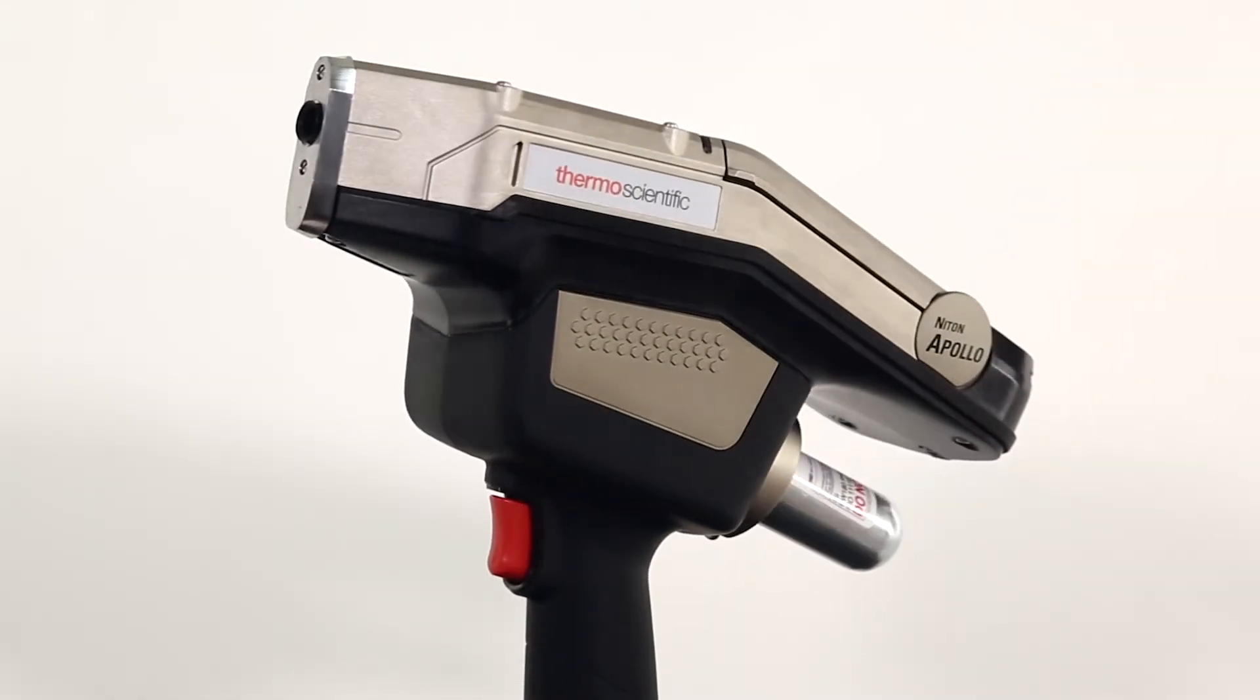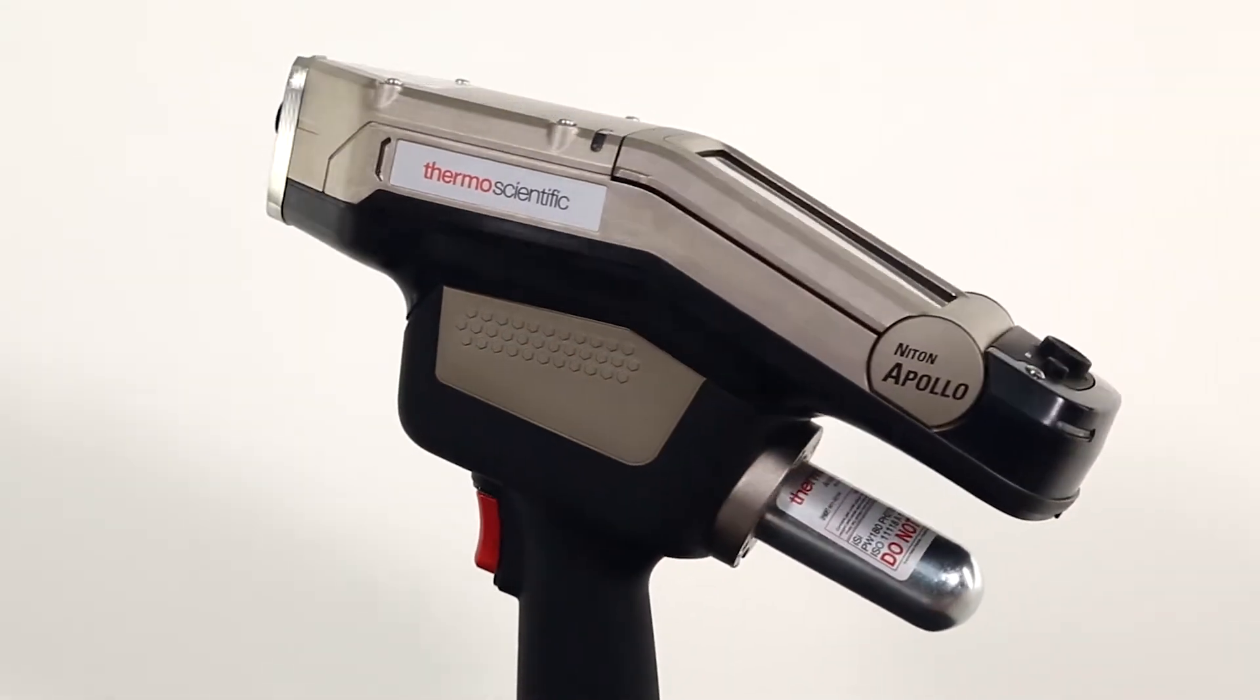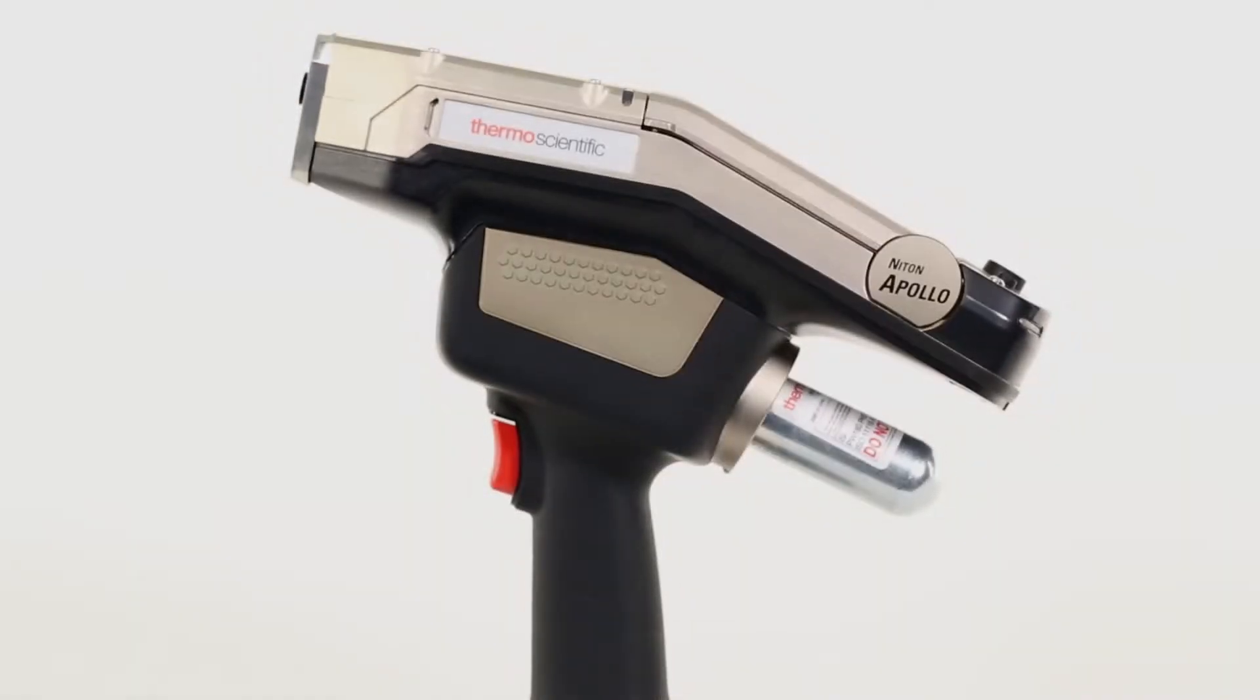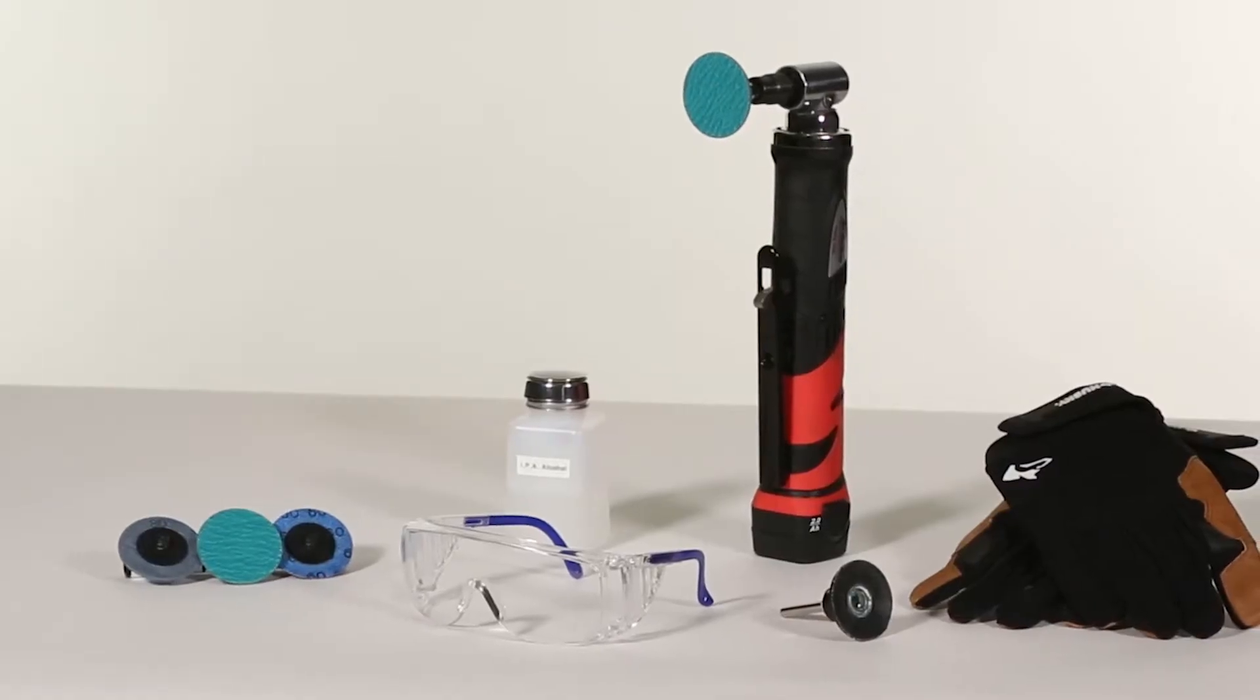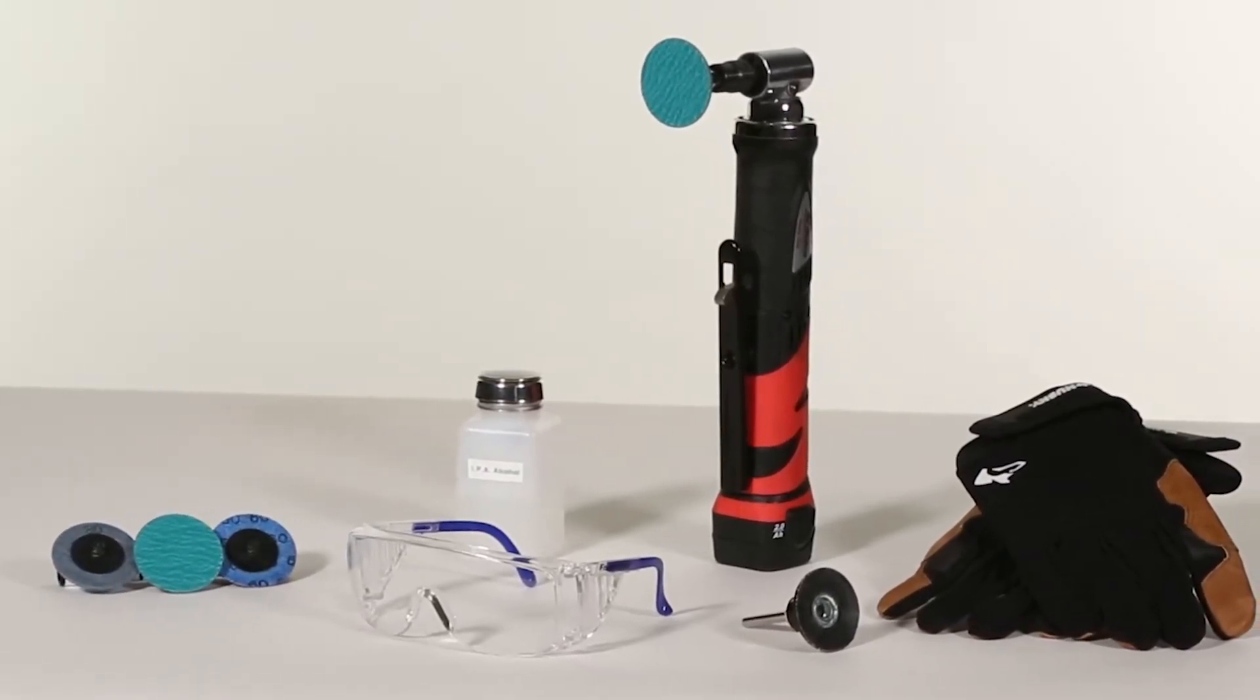This video will provide you with instructions on how to prepare a sample for the Niton Apollo Handheld LIBS Analyzer. Before proceeding, a variety of materials are required to perform sample preparation.